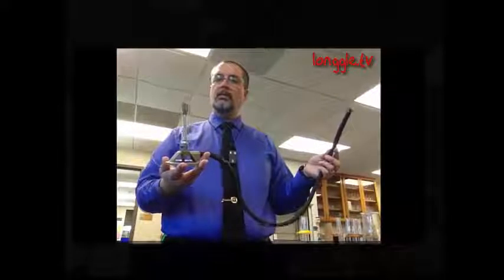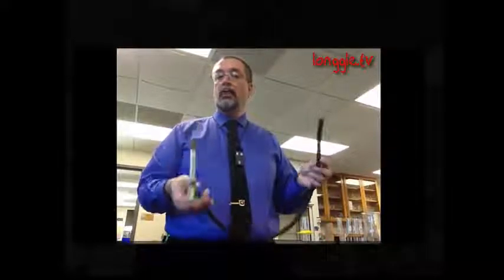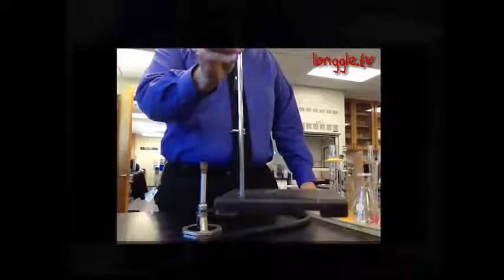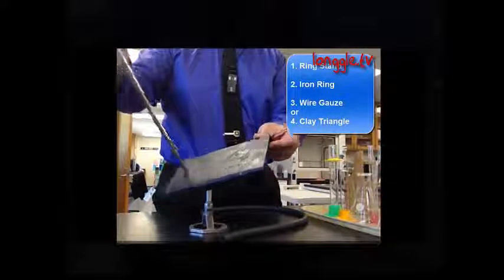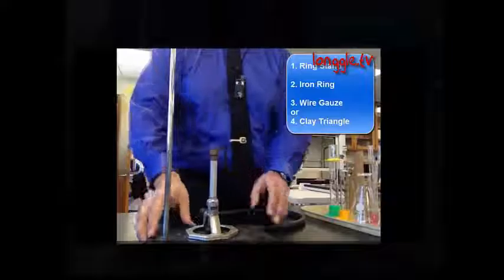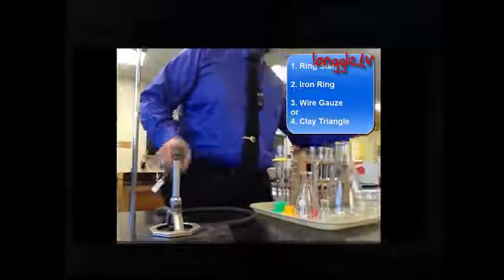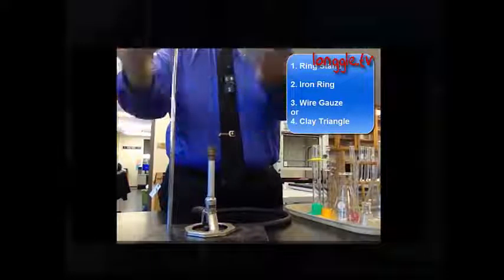Well, we can hold something directly over the flame using one of our tongs, but sometimes we just want to let it sit, especially if we're going to let water boil. And so if we want to do that, we're going to set up a little structure called a ring stand with a ring and some other items that we might put on. So here is a ring stand, and it has this little platform base. We can often put our Bunsen burner directly on there, and then we can clamp something to the stand itself. In this case, I have an iron ring.